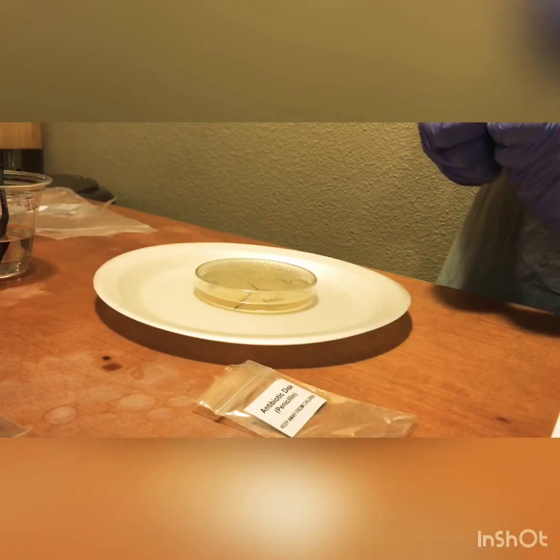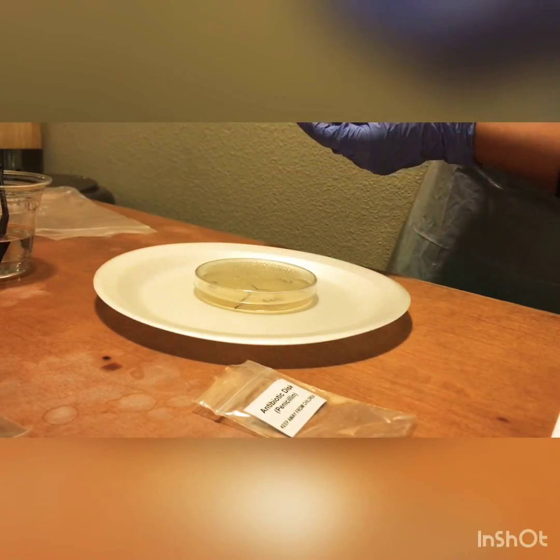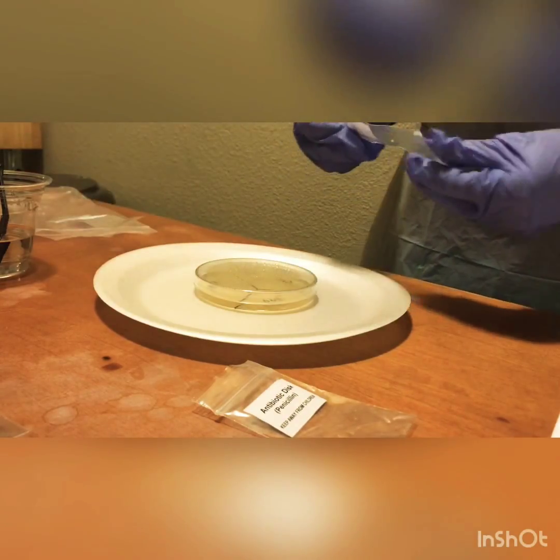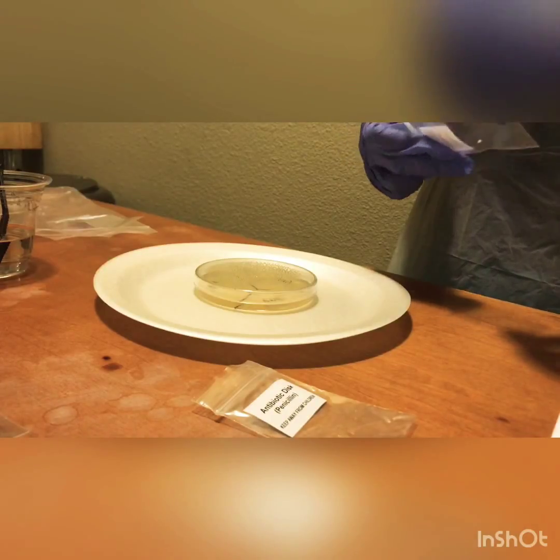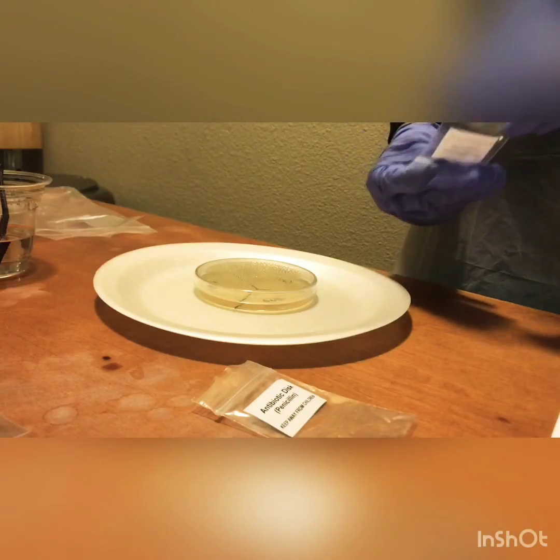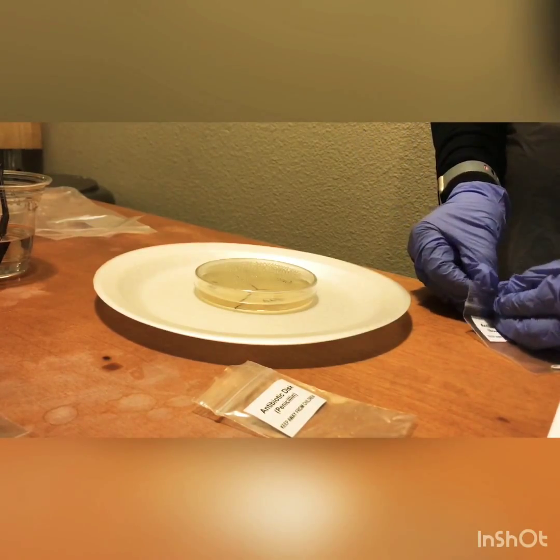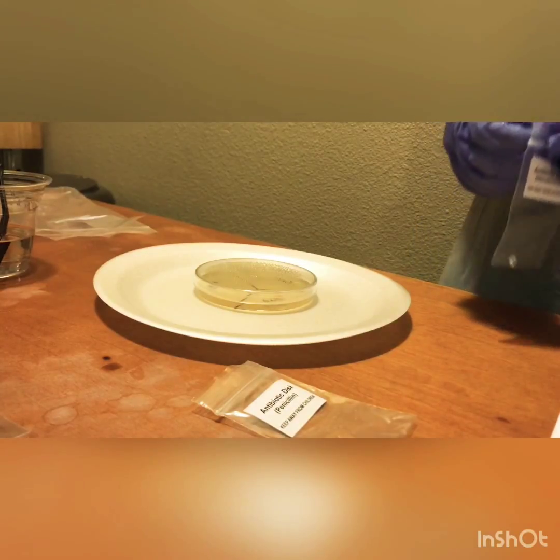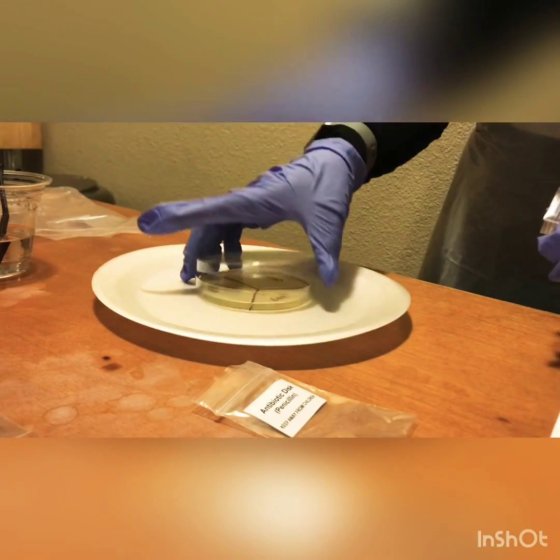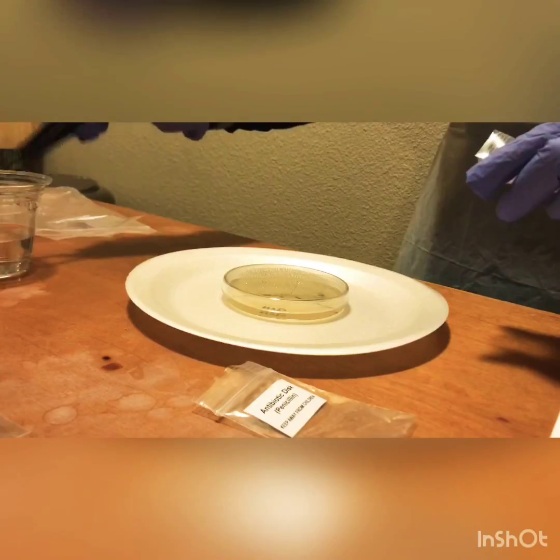Now we're going to move forward with the next 2. We have the novobiocin and the gentamicin, and we're going to repeat the same steps for all of these, placing them where they are labeled. So we're going to open the next one. This one's going to go here on this side, so I'm just going to twist my plate so I can get it ready to go.